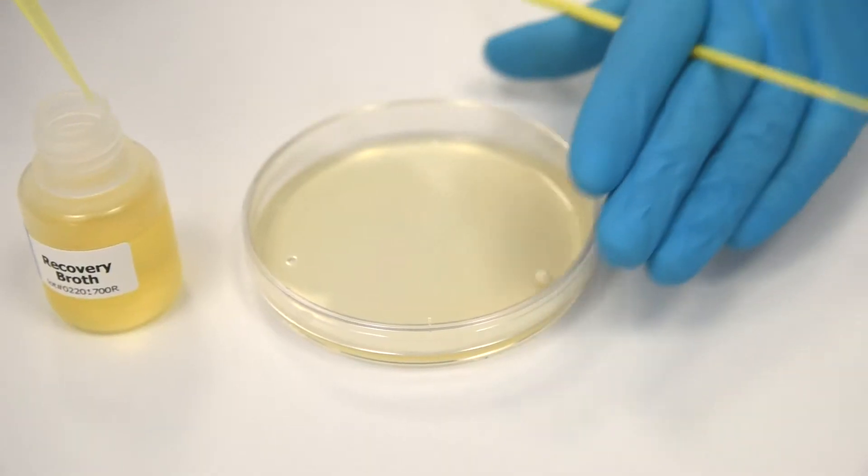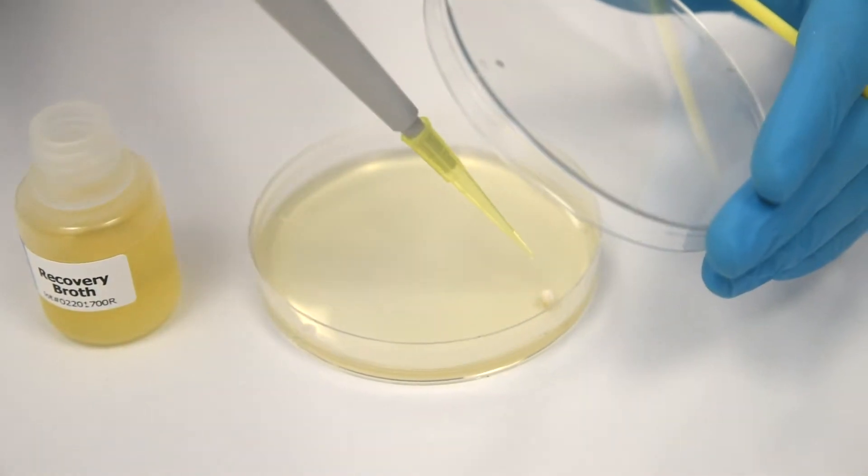Step 2: Dissolve the bead by adding 10 µL of Recovery Broth.